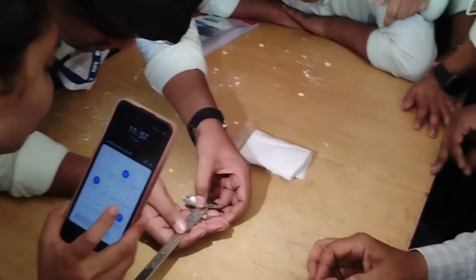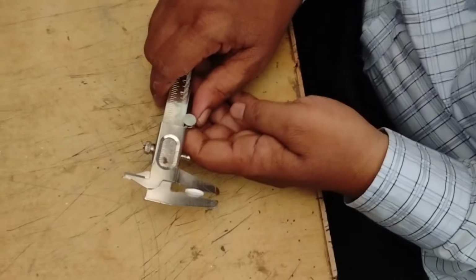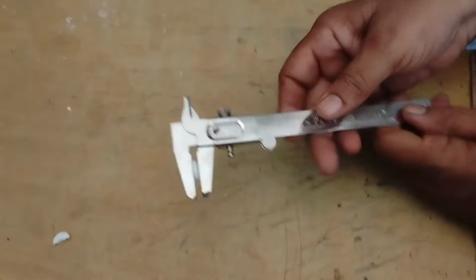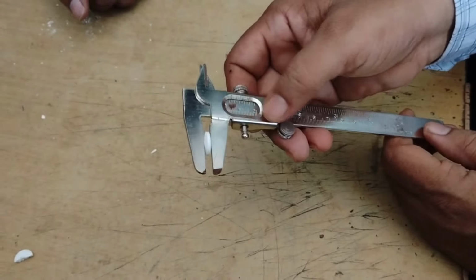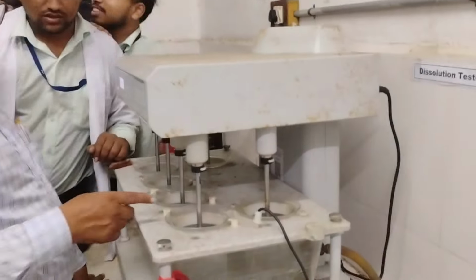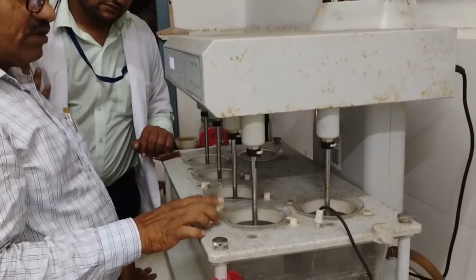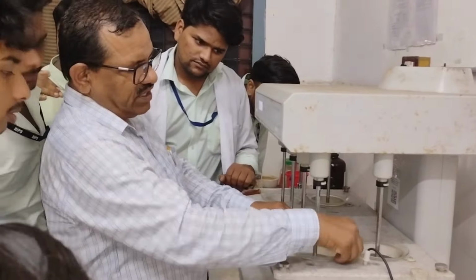Fifth test is the friability test. Friability is tested to see whether the tablet is stable to abrasion or not. It is tested using a Roche friabilator. This is made up of a plastic drum fixed to a machine which is rotated at 25 rpm for 100 revolutions. Then the 20 tablets which were weighed prior to the test are taken out of the drum, cleaned with a cloth and weighed once again. The weight loss must not be more than 0.5 to 1.0% for a conventional tablet.